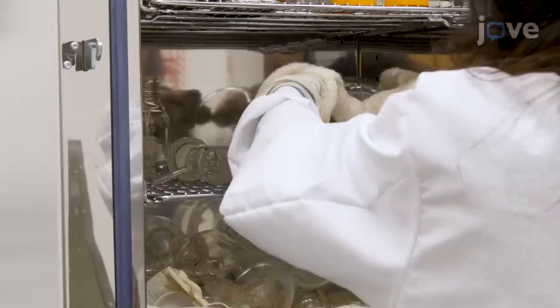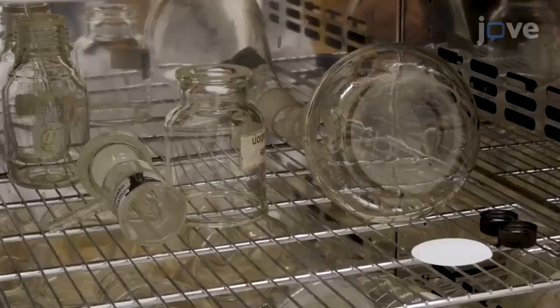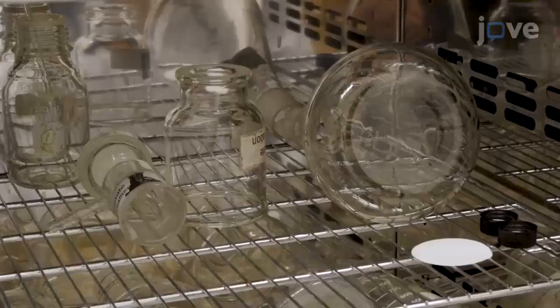During this time, preheat two 20 mL glass vials, vacuum filtration glassware, and filter paper in a drying oven at 90 degrees Celsius.